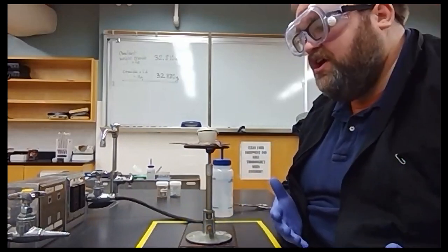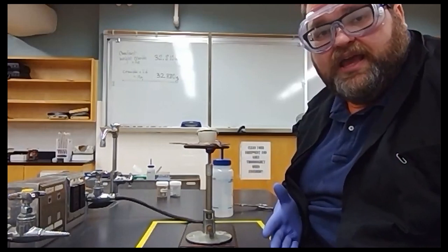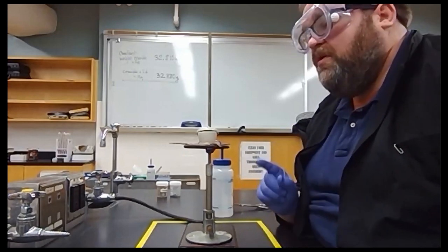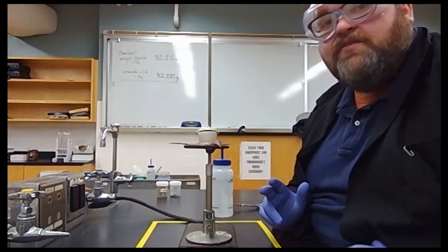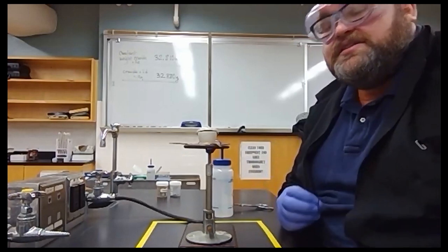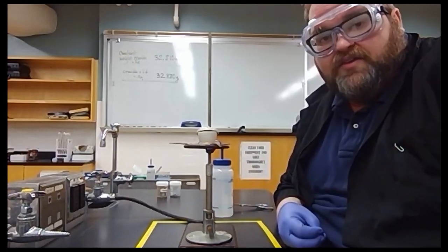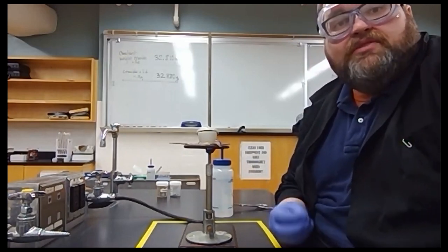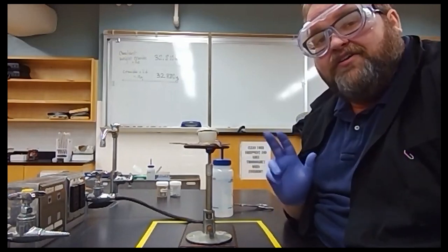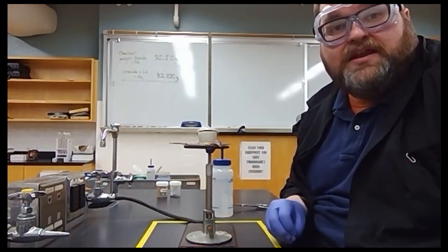So we're going to heat this intensely for another 10 minutes. During that 10 minutes that magnesium nitride to hydroxide to oxide reaction is going to happen. When that's over we now have our final product and we're ready to obtain its mass.